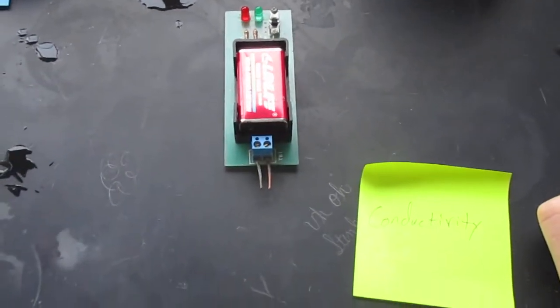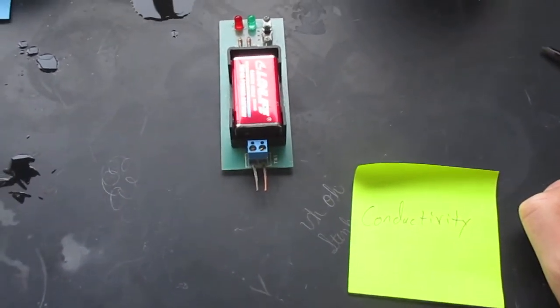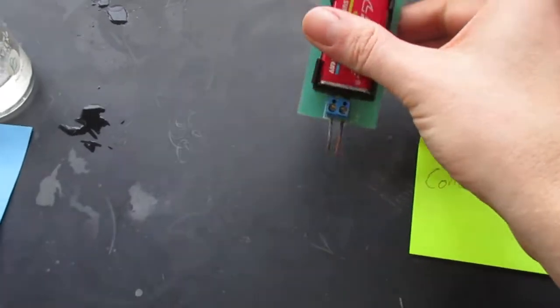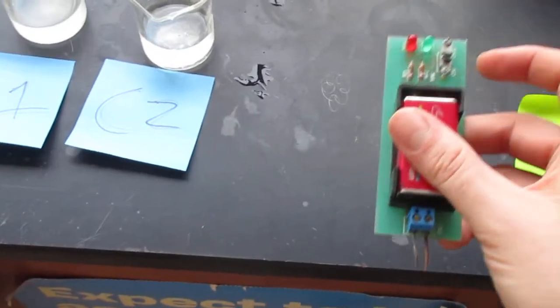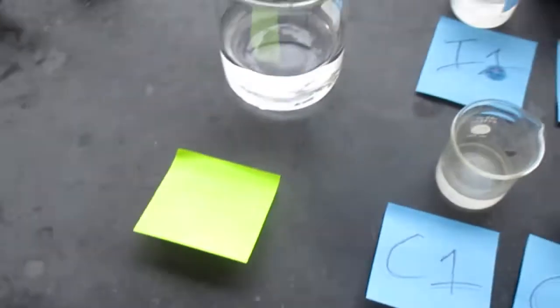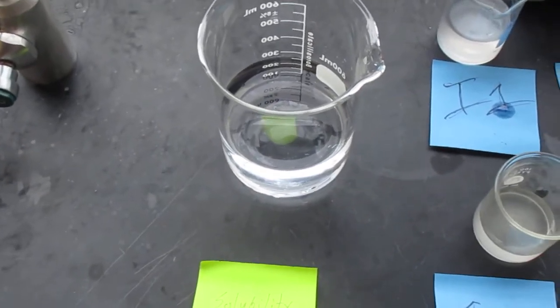The last test is the conductivity test. This is a conductivity tester and it is on. It allows you to see if something conducts electricity. I mentioned that there's water in here.